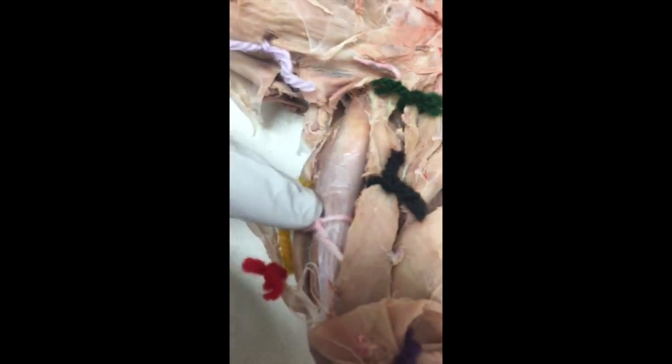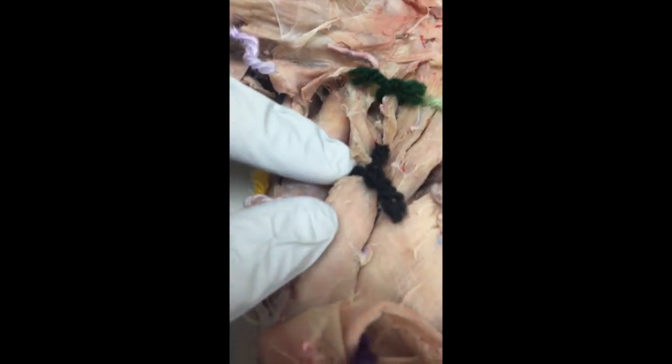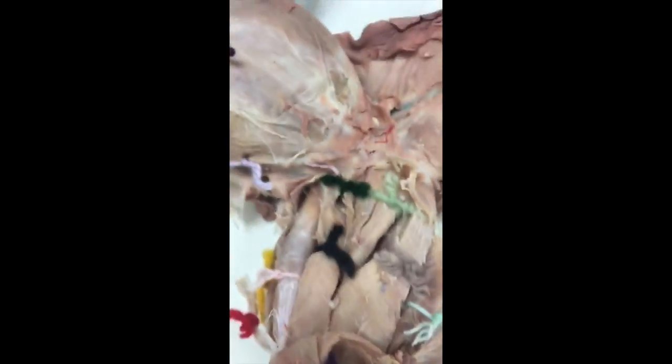Looking at the cat's anterior upper leg, we can see the quadriceps, and right here we have the vastus lateralis, which is a synergist to knee extension, and then we have the rectus femoris, which is the agonist of knee extension, and it has pennate fibers, which show the direction of the muscle pull. And medial to the rectus femoris, we have the vastus medialis, which is another synergist to knee extension.